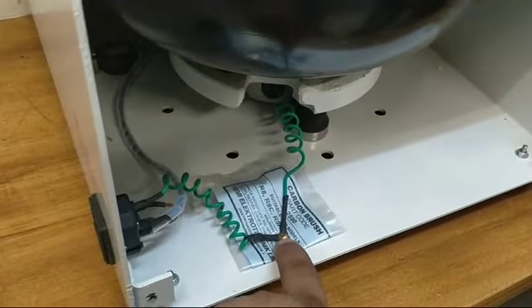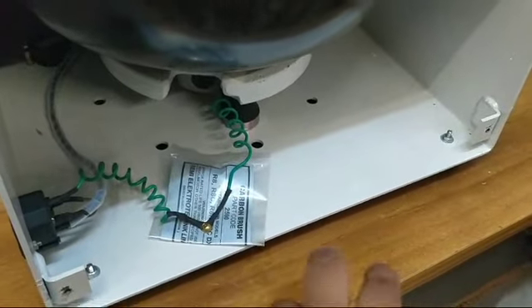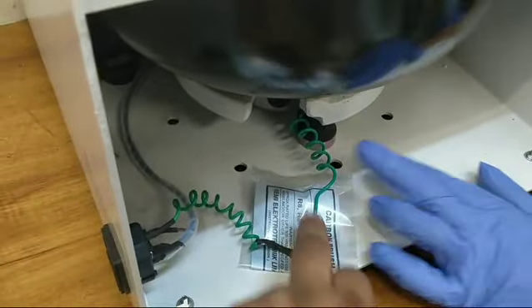Okay, remove this screw, remove this carbon brush. Then remove this screw, then it will come out. Then it will come out. There are two sets.